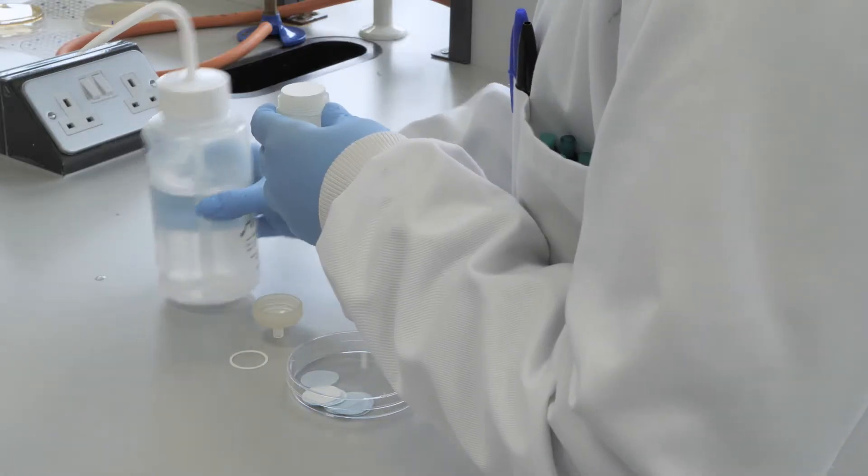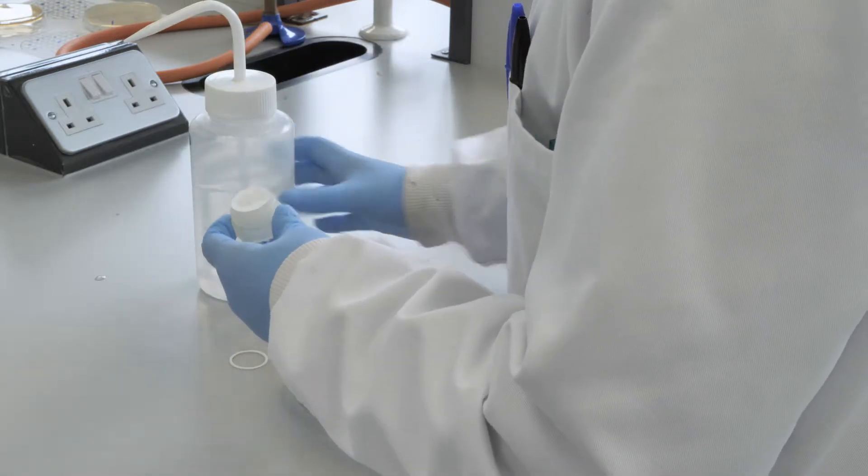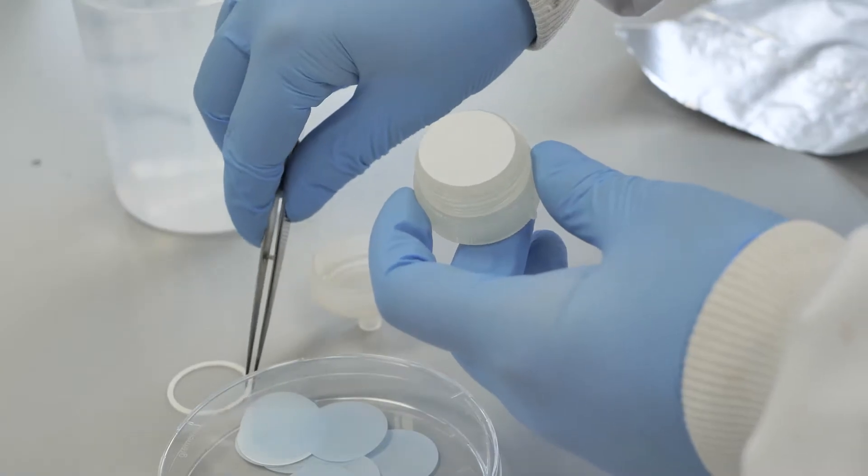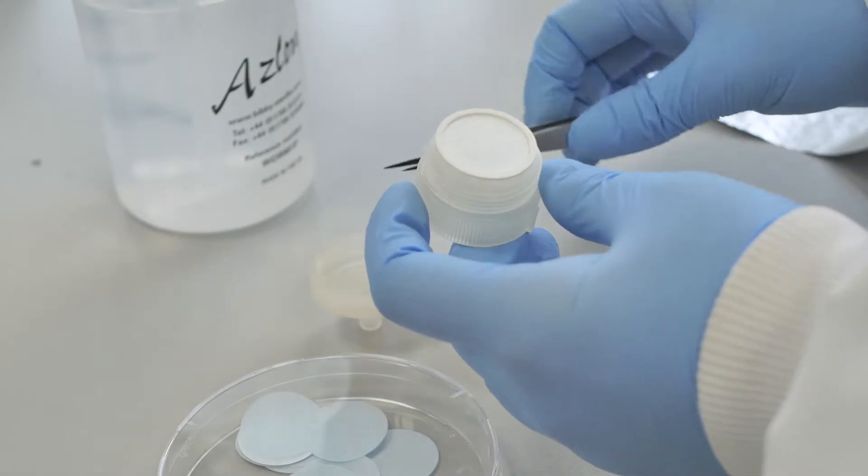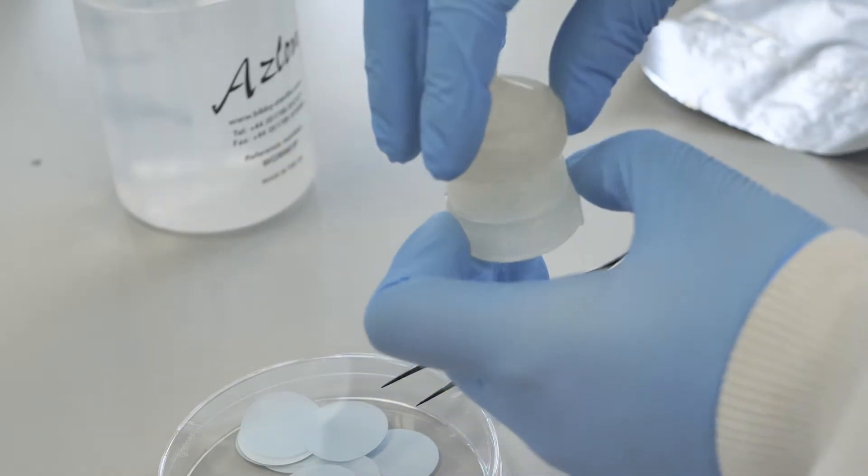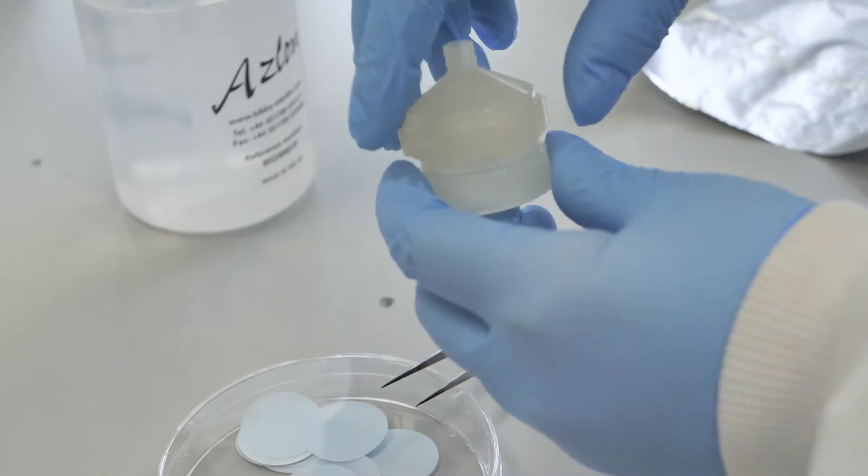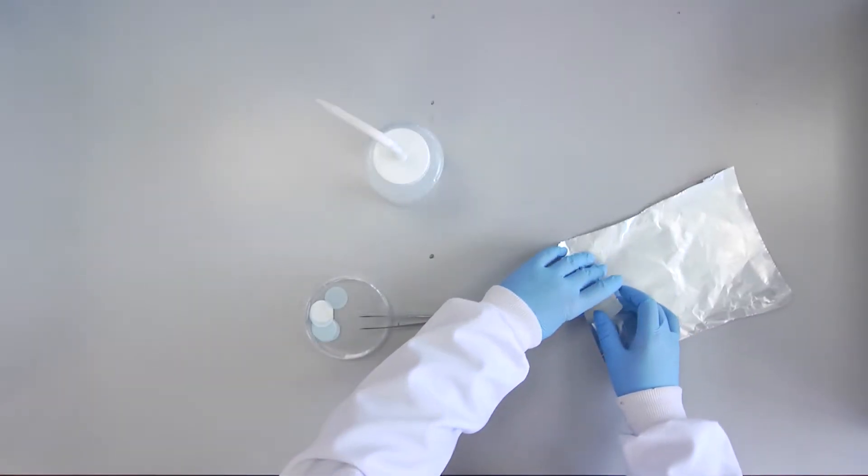A drop of water was added to prevent membrane splitting during autoclaving and an O-ring seal added. The filter housing was closed loosely, wrapped and autoclaved.